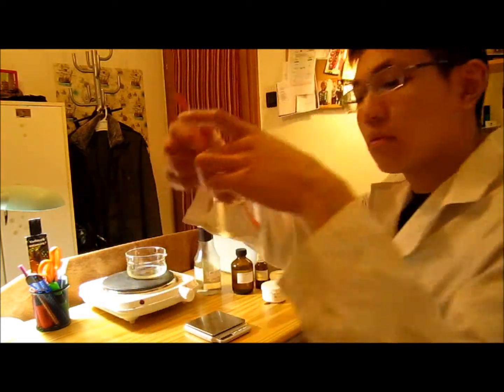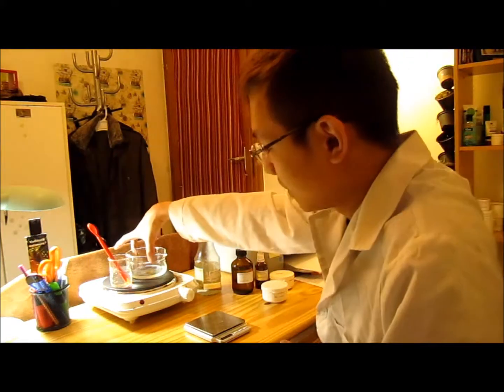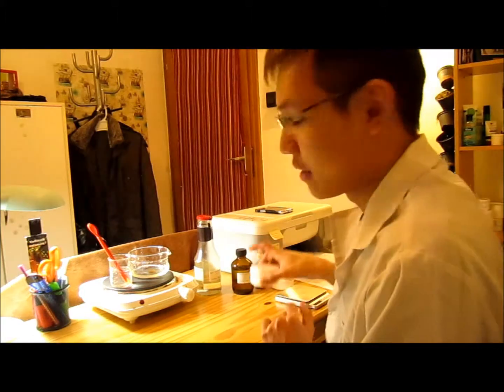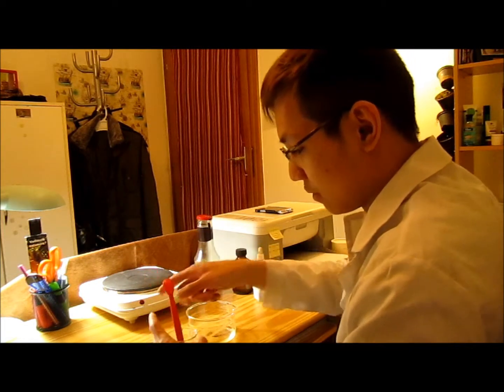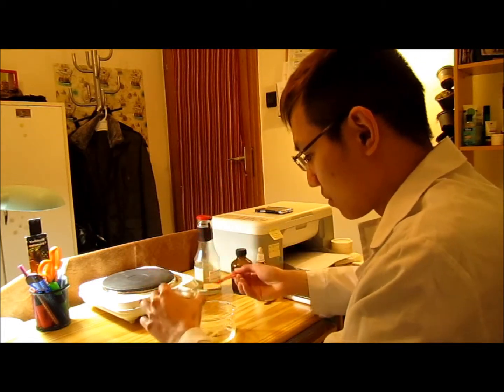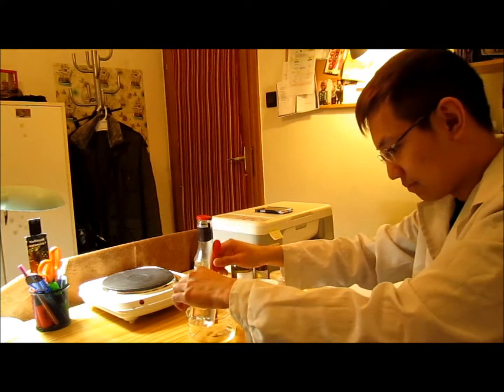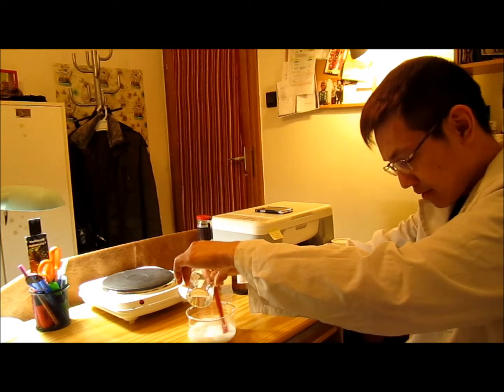Let's wait. So after around 10 minutes, you can see the urea has already 100% dissolved in the solution, and the base has already melted — pretty good. Here comes the next step: we will mix them together. You always have to ensure that you mix everything slowly and thoroughly to ensure nice cream formation and not nasty precipitation. Slowly and thoroughly.